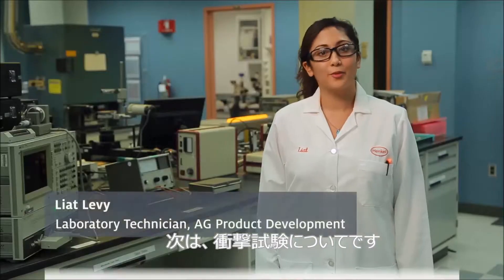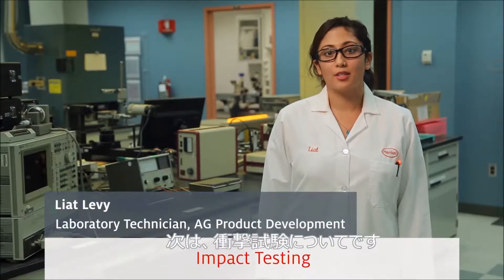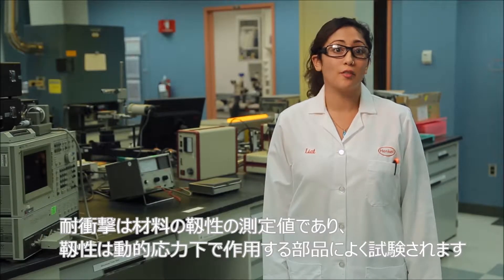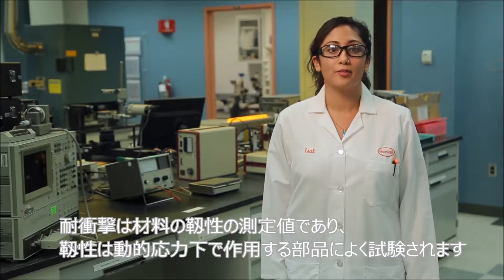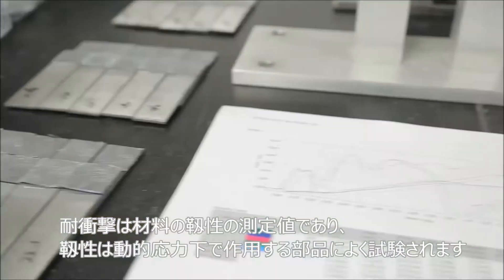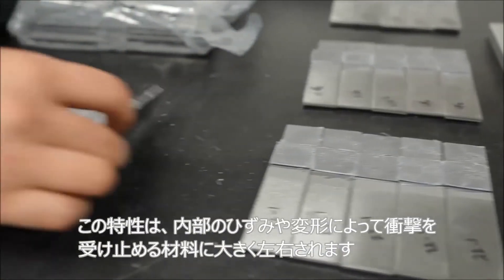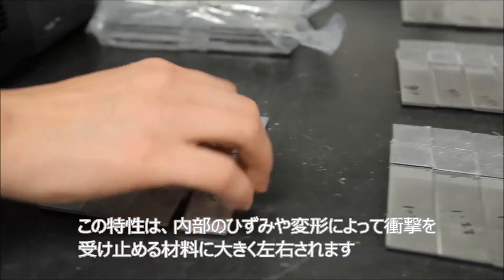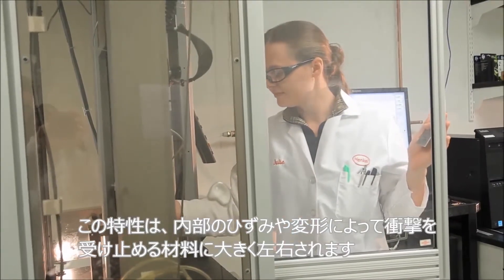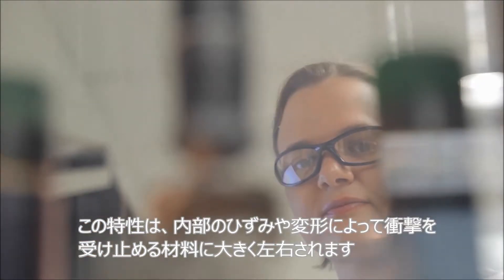Now it's time for impact testing. Impact resistance is a measurement of a material's toughness, which is often a main requirement for components operating under dynamic stresses. This property is highly dependent upon the ability of the material to internally move or deform to accommodate the impact.